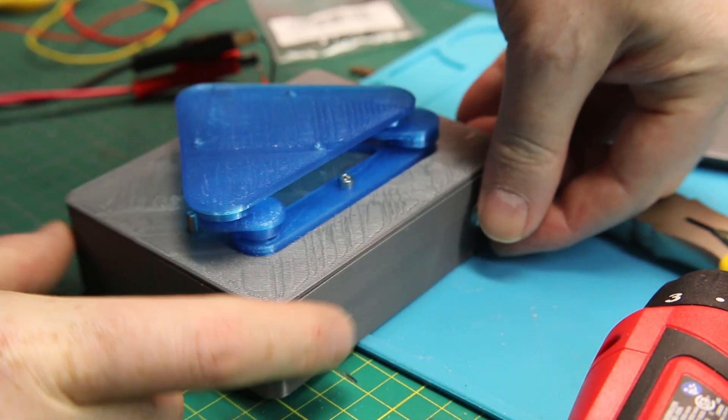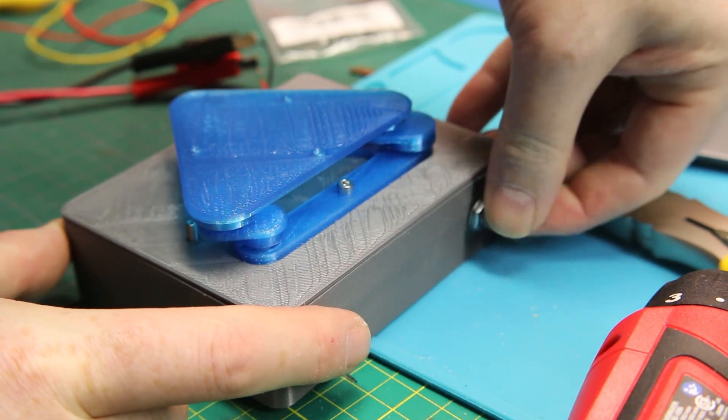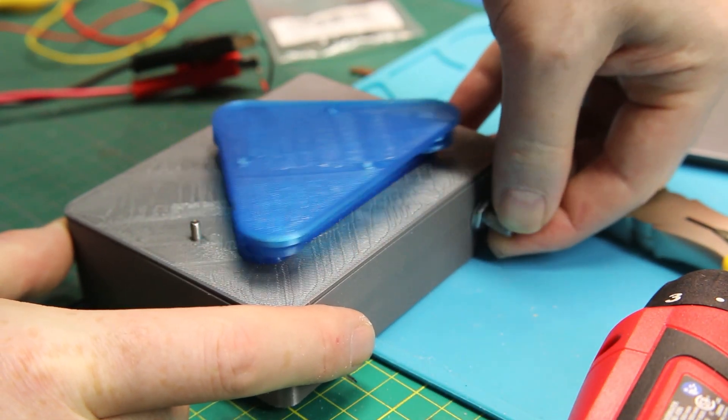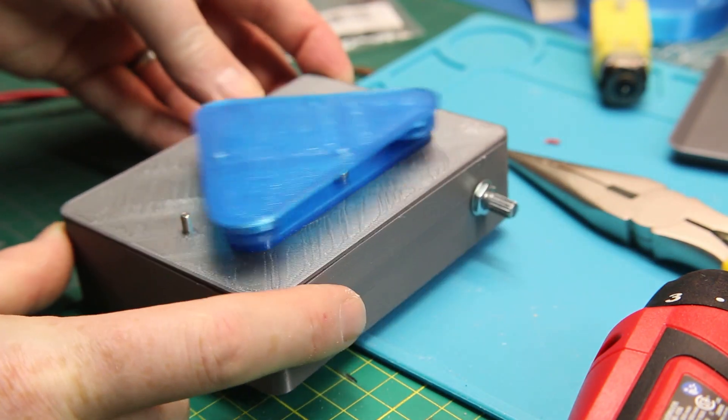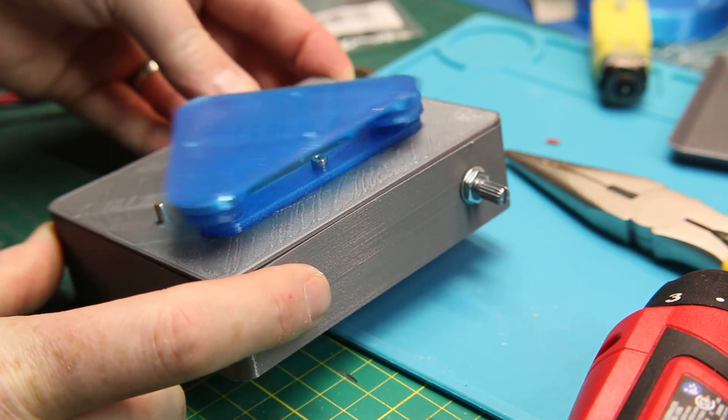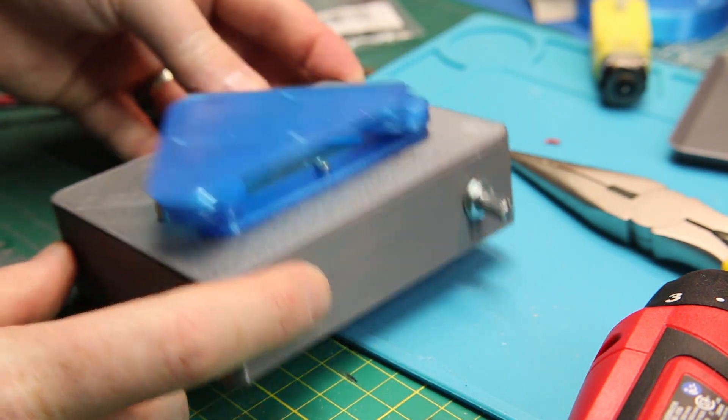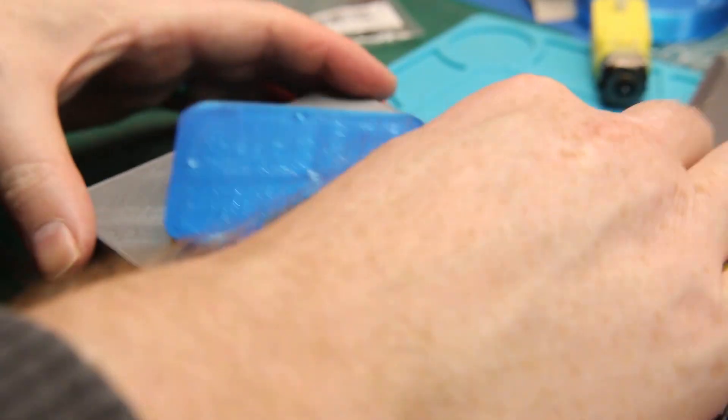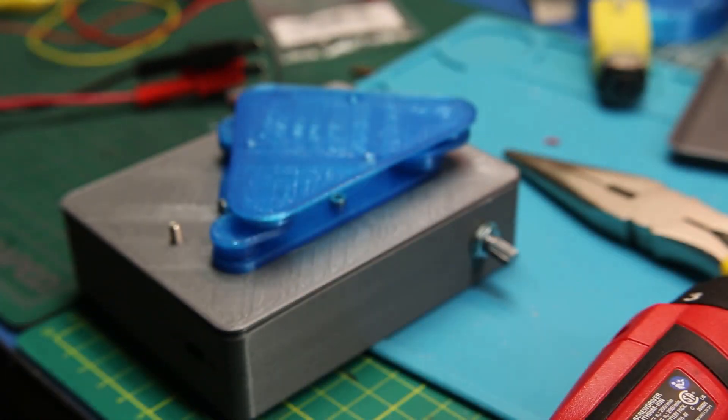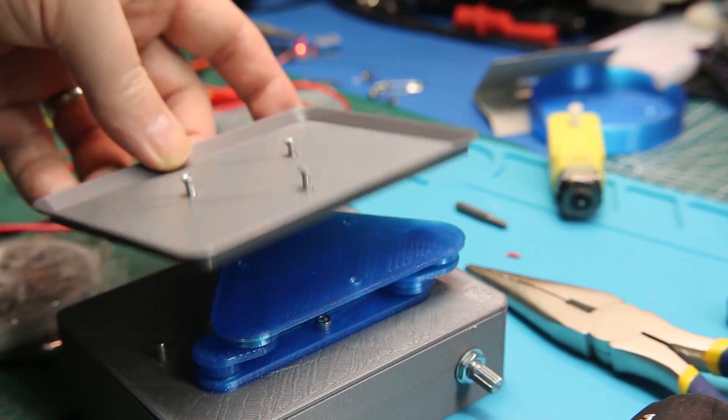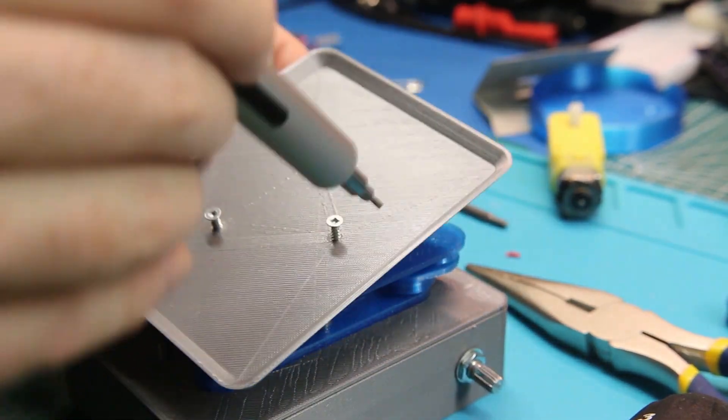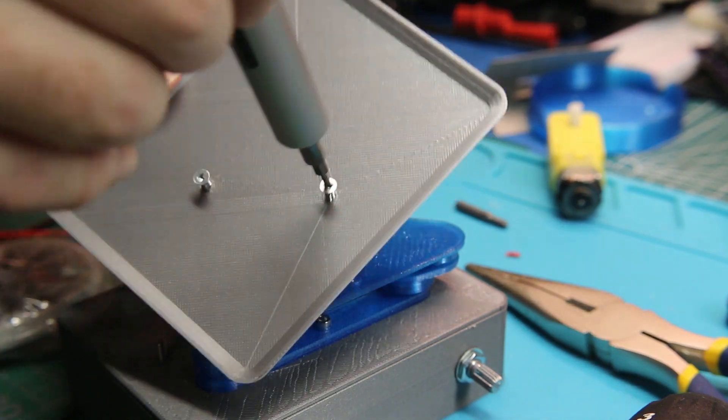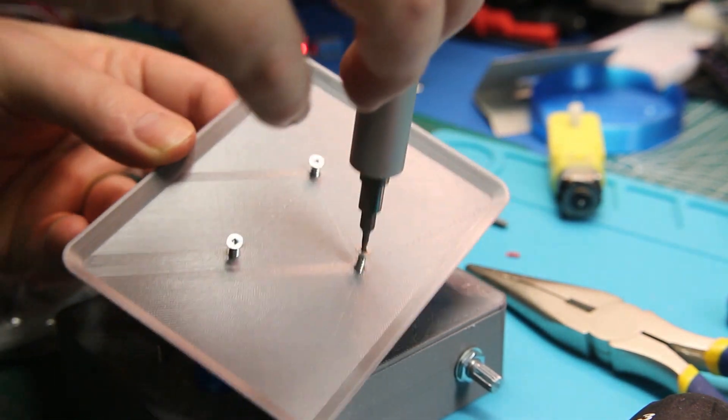At this point I had to go ahead and test things, and sure enough it worked just as intended. Some of the bearings were a little bit tight. I had to do a little bit of work here and there just to take a little bit of load off of it because of the way I had pressed them in, but then everything was nice and free, so it was time to put the top cover on.